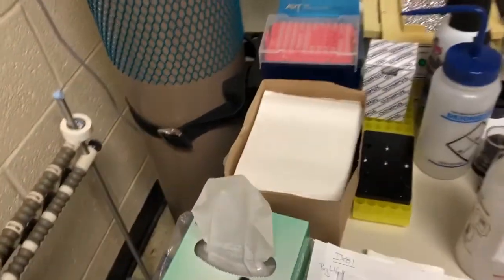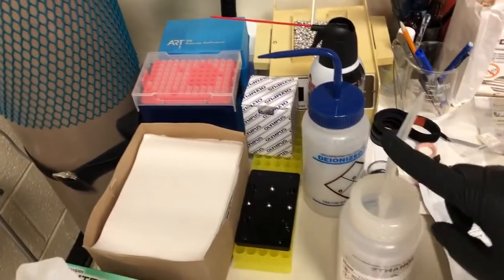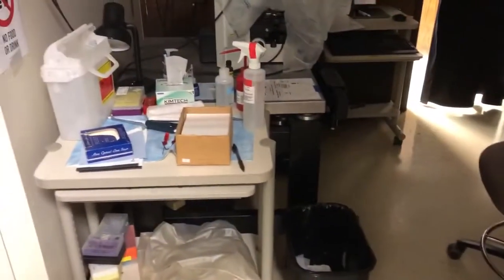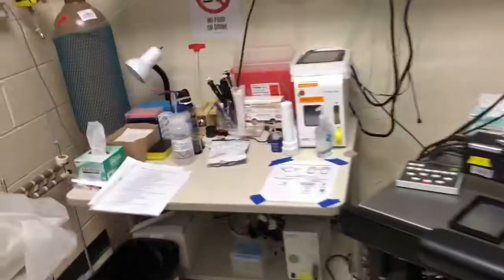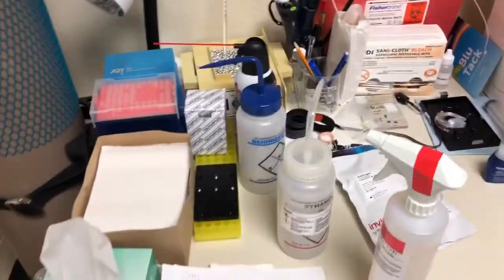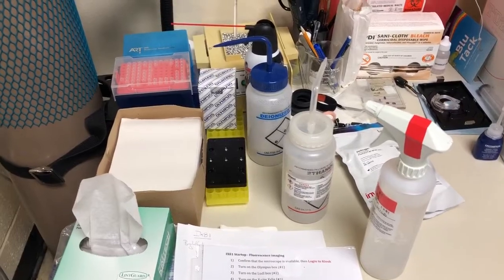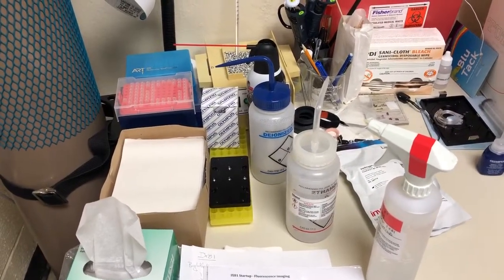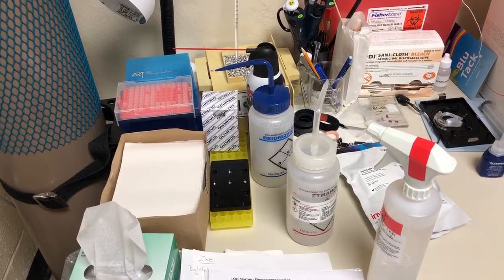So let me show you where all that is. Let's remove the dust cover. We have kimwipes here, lens paper here, pure ethanol. That'll be used for the eyepieces here. And there's a bottle of 70% ethanol either on the BX-61 or on the Beale. So now it's on the BX-61. So I'll grab this. Now I have everything I need to clean up. That's a little bit hard to do with one hand, so I'm going to stop the video, clean up, and then come back to the startup procedure.